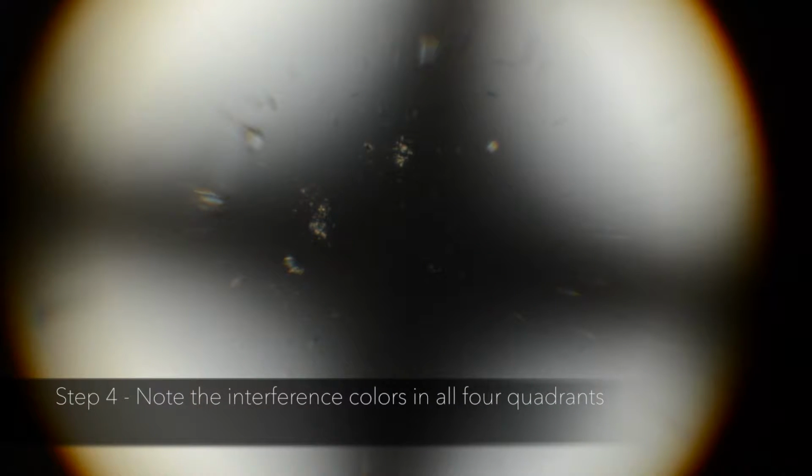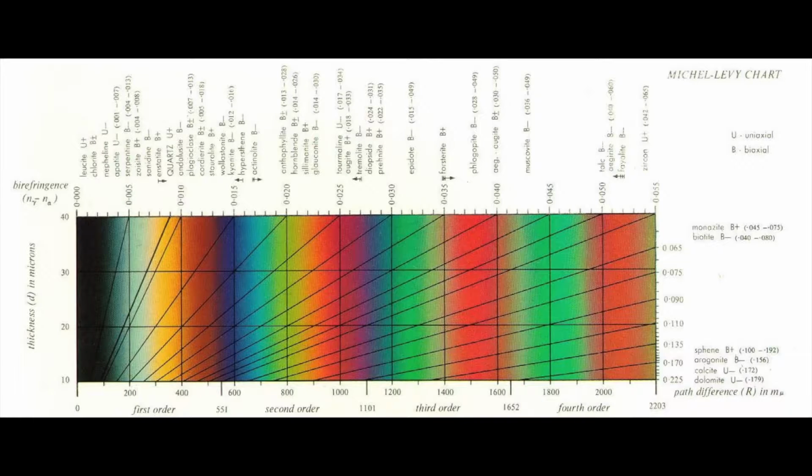In all minerals, interference color bands circle the figure. Sometimes we don't see them because they are outside of our field of view in the microscope. These bands are called isochromes, and they increase in order from the center. Step 4. Note the interference colors in all 4 quadrants. In this example, all 4 quadrants are a first-order white.